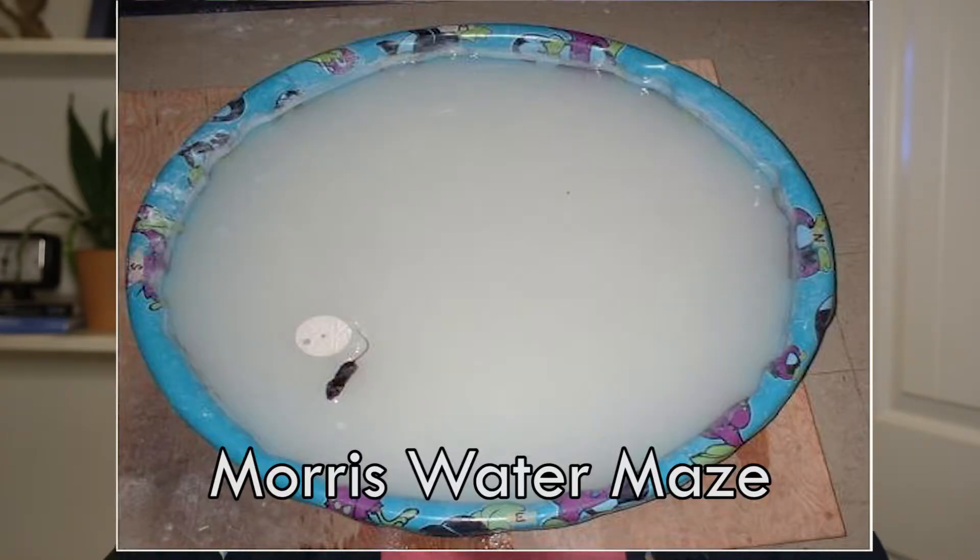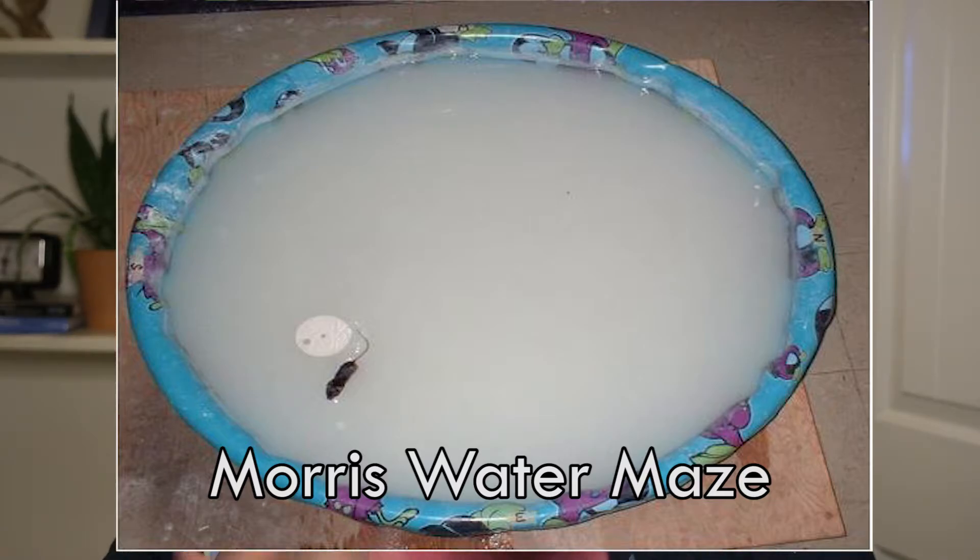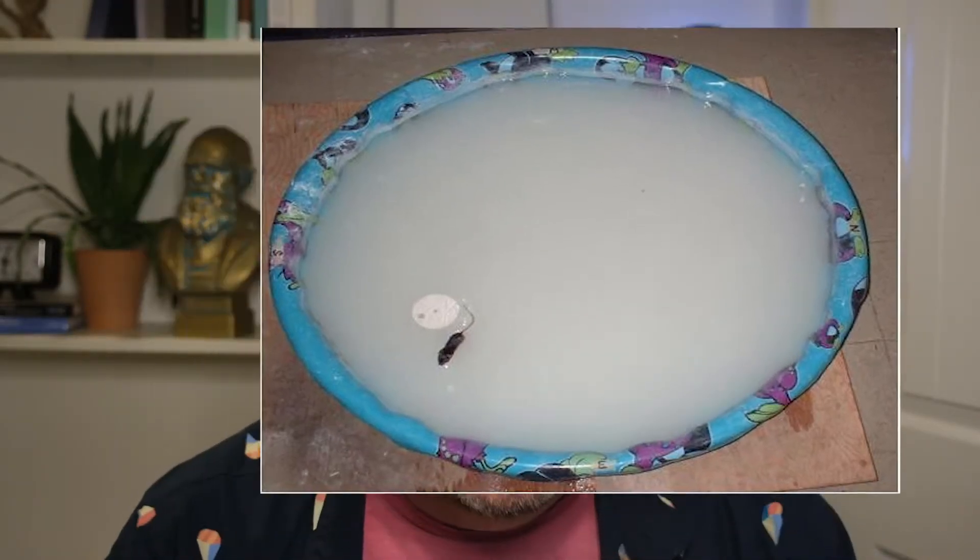Time to get a little different. For number four, let's look at the Morris water maze. You take a plastic kiddie pool, fill it with water, and add a non-toxic dye to make it milky white so you can't see through it. You place a platform just below the surface somewhere between the center and the walls. You drop a mouse into the water and watch it swim — or better yet, film it from above. Early on, the mouse will hug the walls, but will eventually find the platform. After repeating this a few times, the mouse learns to swim straight to the platform. You can measure how long it takes to find the platform or how far it travels.